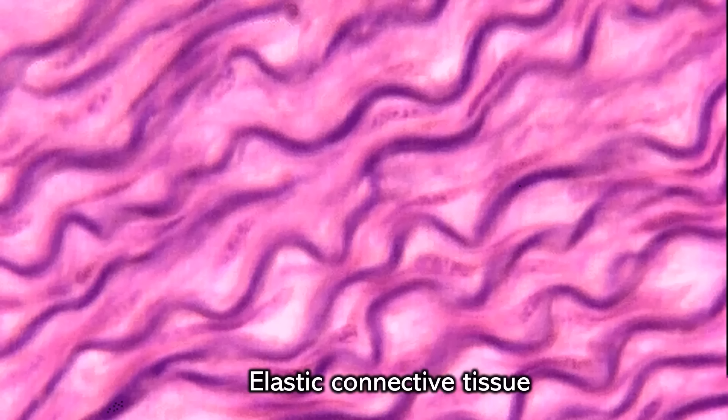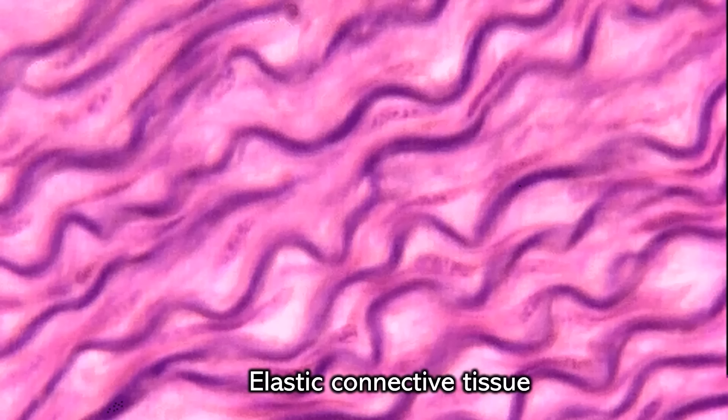You're seeing purple little waves — those are bundles of elastic — over a background of collagen which is kind of out of focus. That tells you that this is elastic connective tissue.